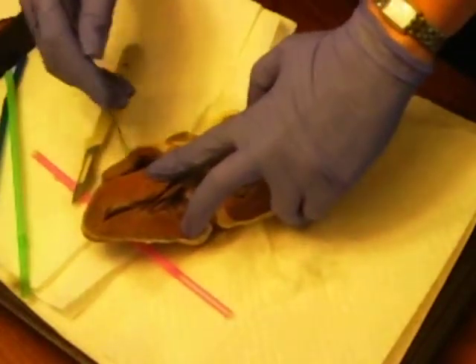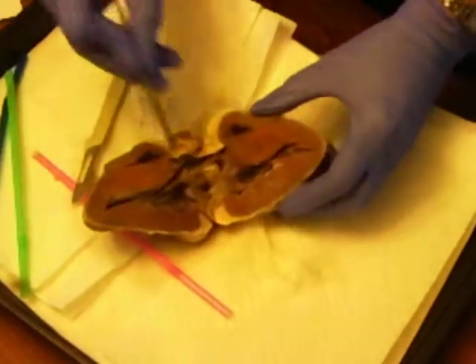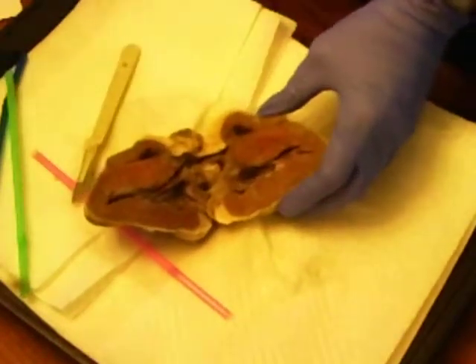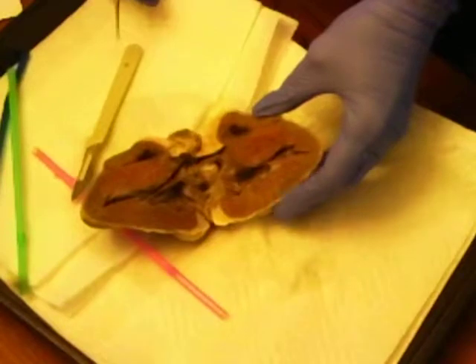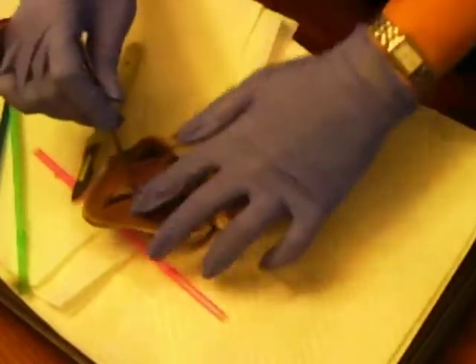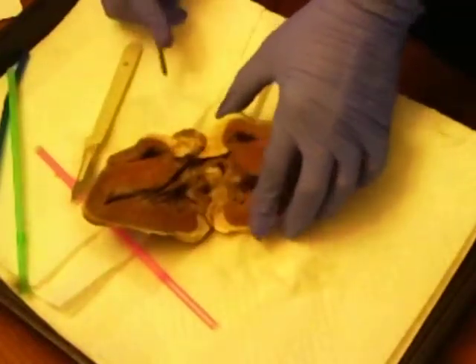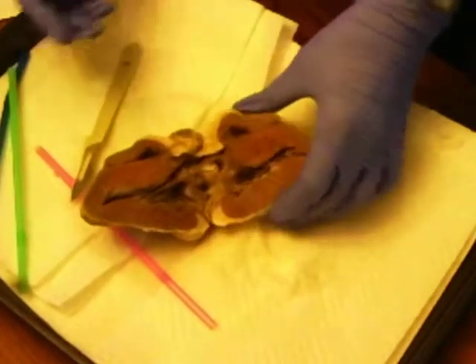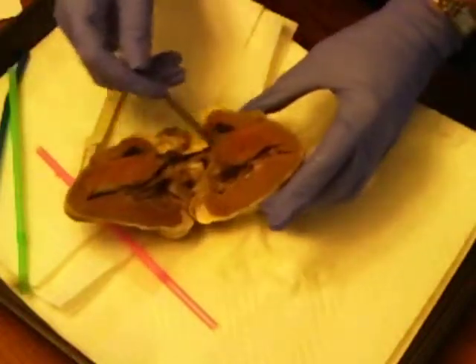Okay, this is the pectinate muscle of the right atrium. The myocardium would be here on the left and right ventricles. The trabeculae carneae are the inner surface of the ventricles, so it's that kind of white right there. The myocardium, oh, I've already shown that, sorry about that. And the interventricular septum, which would have been the inside of this, is the line that really separates the right from the left ventricle, right there, if you can see that line.